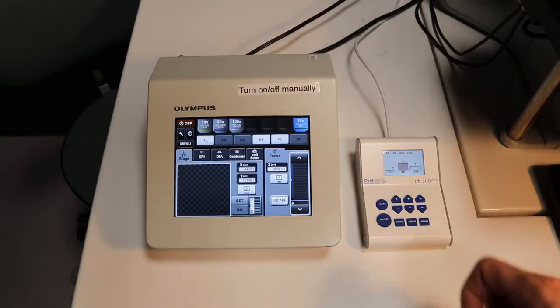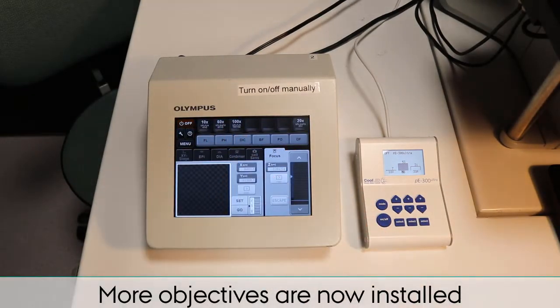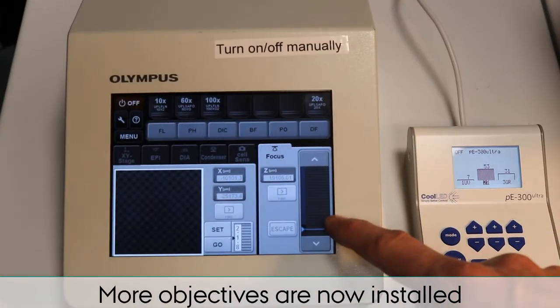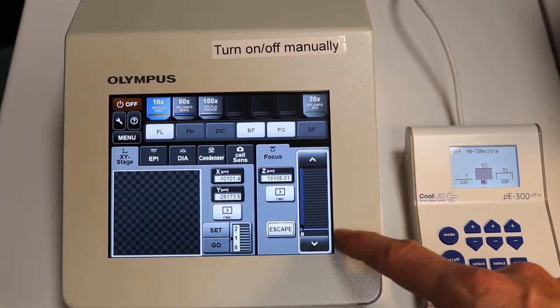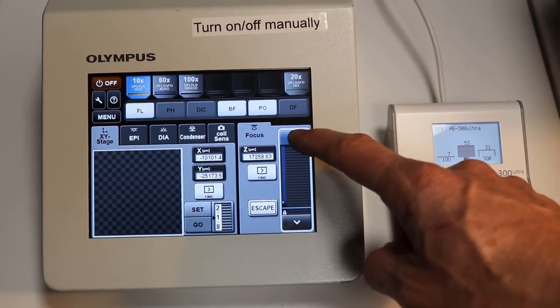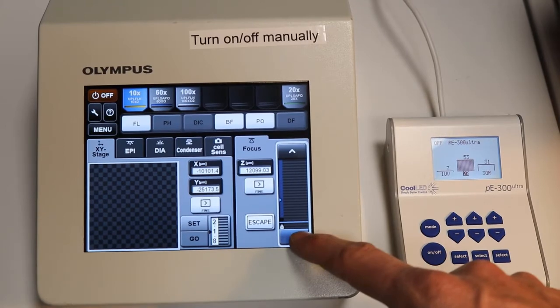Okay, now I will control the microscope from the touchpad control. And first you see the different objectives here. So by touching those, it of course changes objective. And now you can see over here the focus. It's going to the focus position, and you can control it here. So you can see the pointer going up and down again.